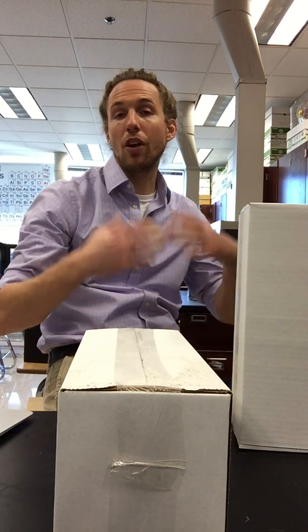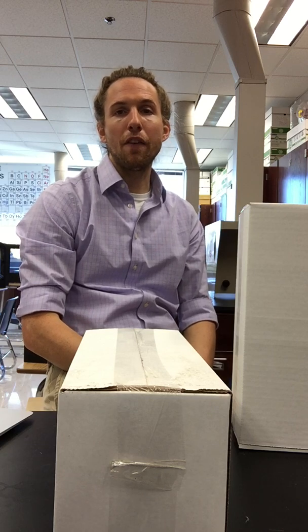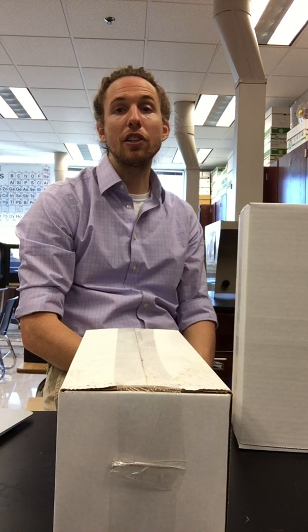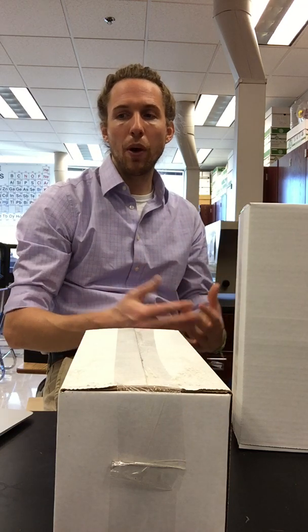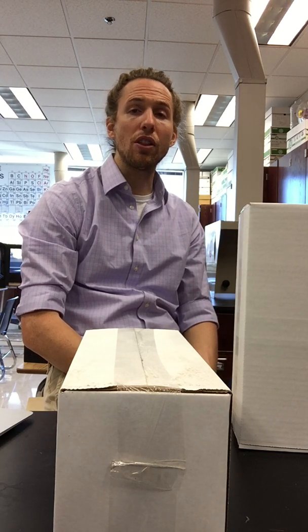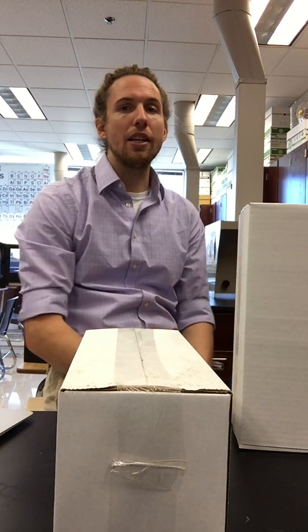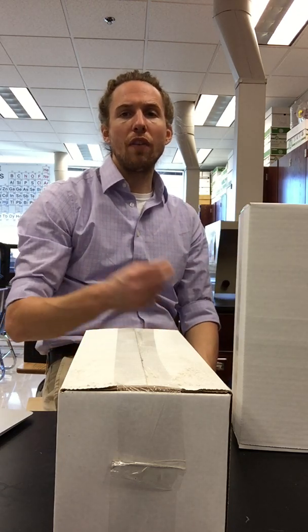lab. And in general, we're doing two different reactions in this lab. One of the reactions is between ferric nitrate and sodium hydroxide, and the other is between copper(II) chloride and sodium phosphate. So let's start off with the iron-containing reaction. This is the one that's Fe(NO3)3 plus sodium hydroxide. So what I did earlier in the day is I went through and I did all of these different reactions.